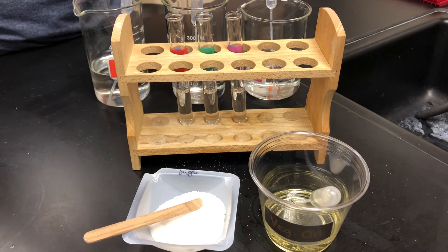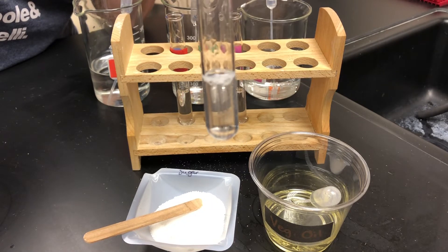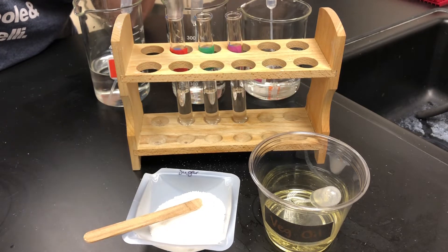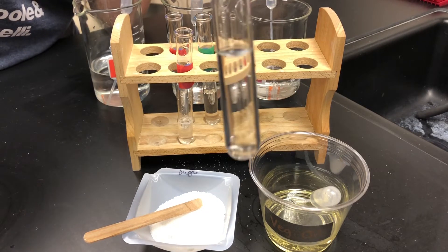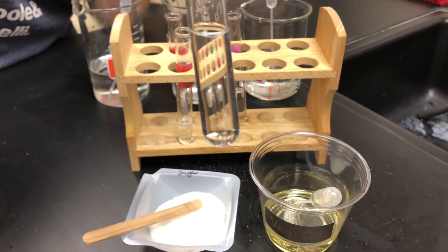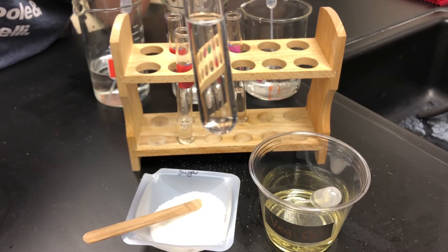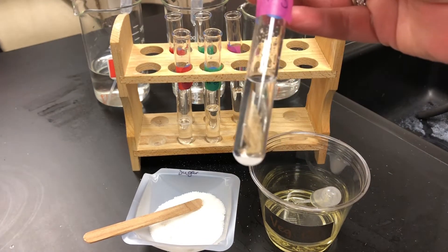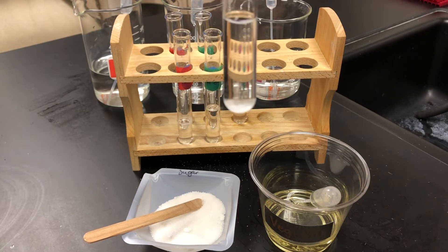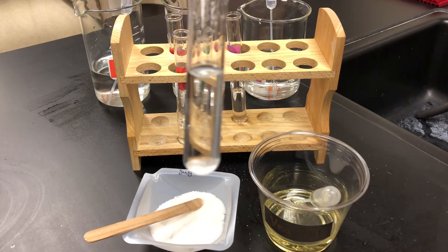Looking at test tube number one, no sugar appears to be inside of the solution, which means that the sugar has dissolved in this liquid. We are now observing test tube with liquid number two and we see the same result — there's no sugar suspended at the bottom of the test tube, indicating that sugar has dissolved in this liquid. We are now observing test tube number three, and as you can see on the bottom, the sugar has still settled, meaning it has not mixed with the solution, indicating that sugar is not soluble in this liquid. It did not dissolve.